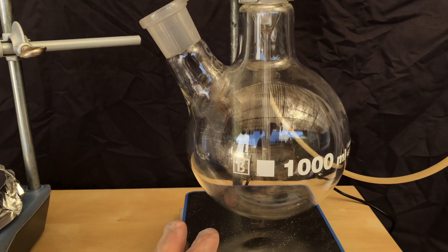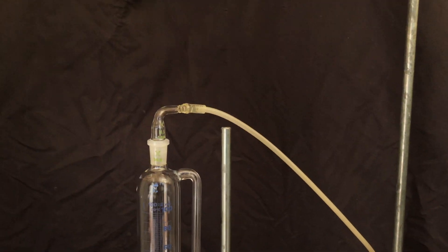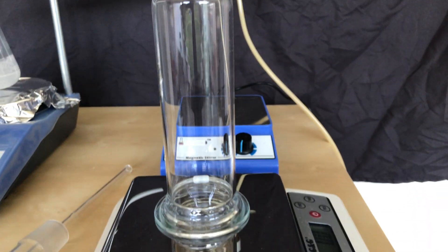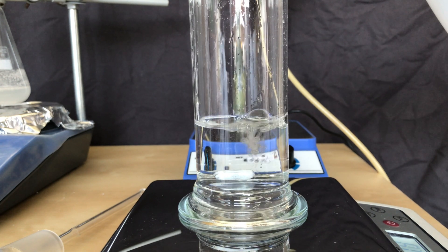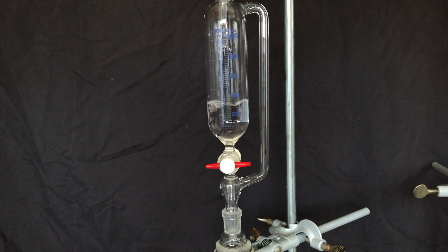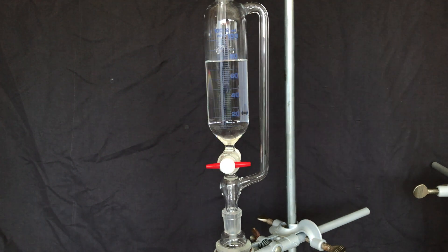A gas tube was connected to the first part of the apparatus. Once everything had been set up, I decided to drastically change the setup. I switched out the round bottom flask for this gas washing bottle because I thought that it might be even more efficient.